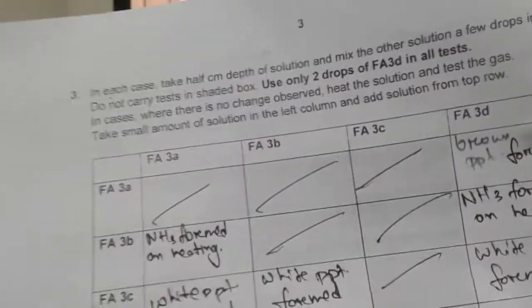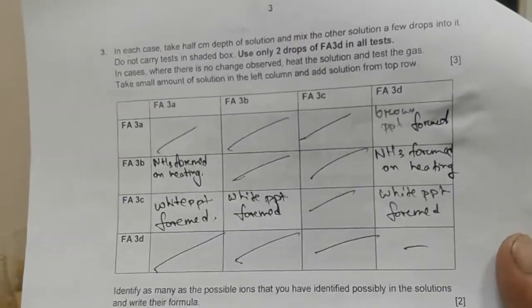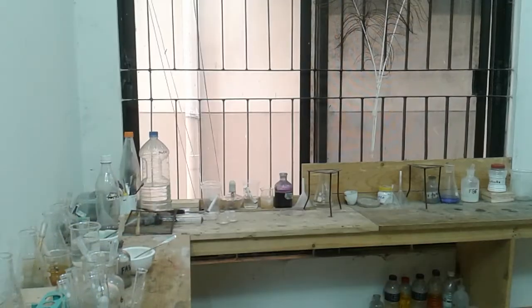So that's up to question number 3, and this is how you will identify the reagents when all of them are unknown. In the past cases our reagent names were given, but here nothing is given. So you will make the observations very carefully and compare them with the data analysis table given. Okay, now let's switch to question number 4.